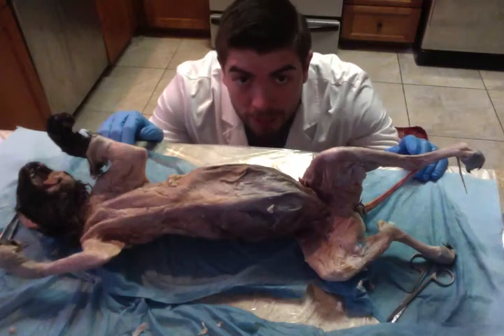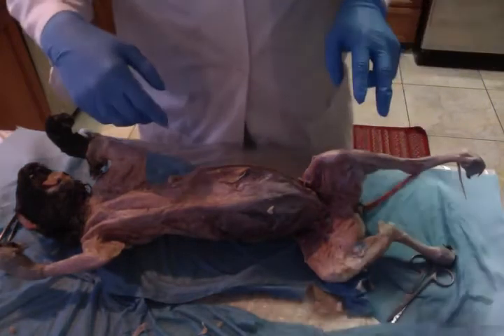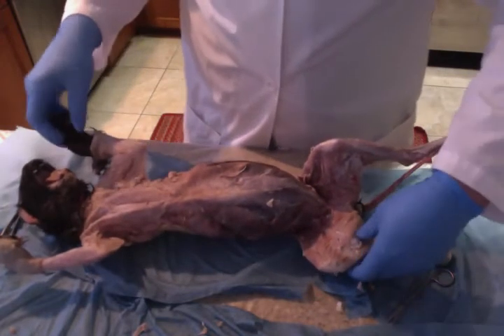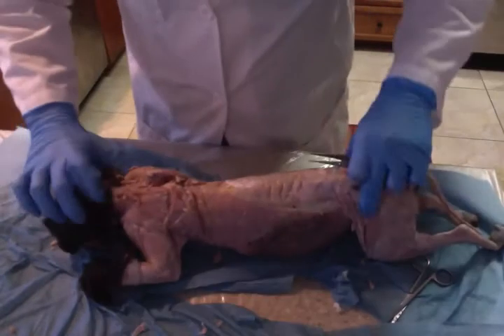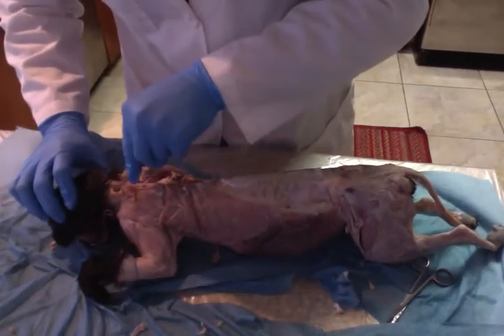Hello, my name is John Lemus and I'm doing my second muscle video on the appendicular muscles. I'm going to start off here with describing the clavideltoid muscle, which is easier if I flip him around here and show his back. The clavideltoid muscles would be right here.